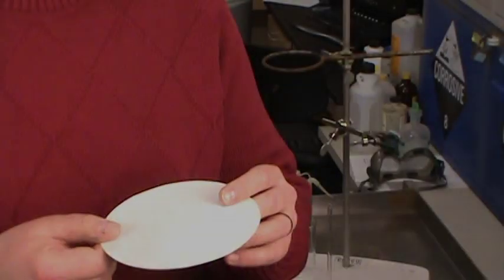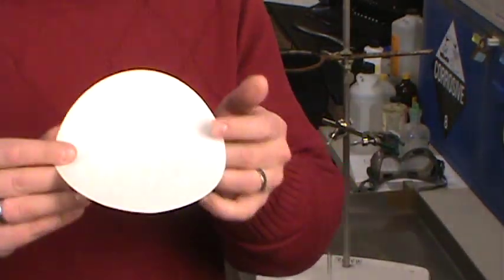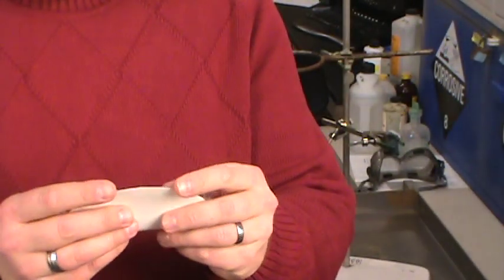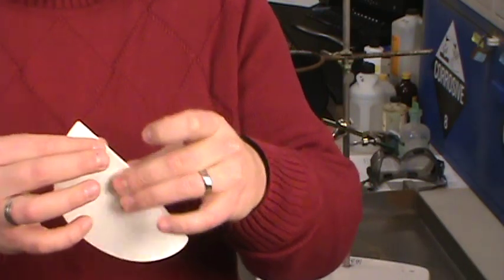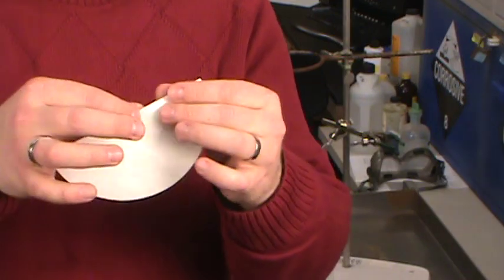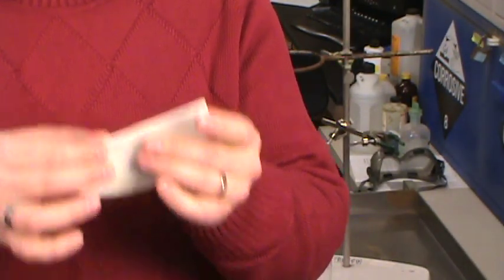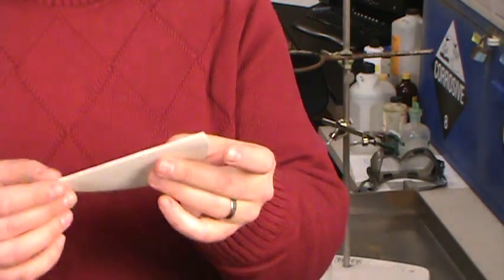We've got a round piece of flat filter paper. Now just as the name implies, a quarter folded cone - if we fold this in half once, be a little bit careful. You don't want to put really tight creases in your filter paper because that damages the fibers and it doesn't filter as well. So pinch them down so that they're folded but don't go too crazy on that.